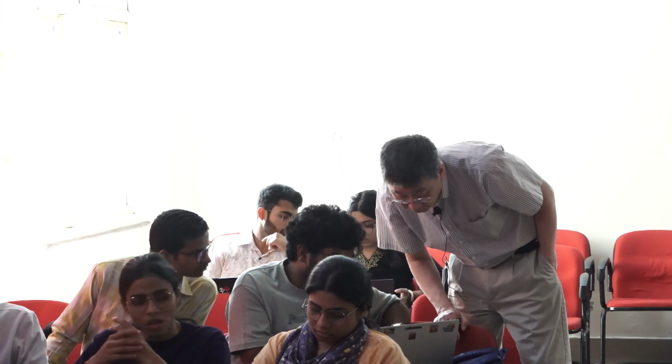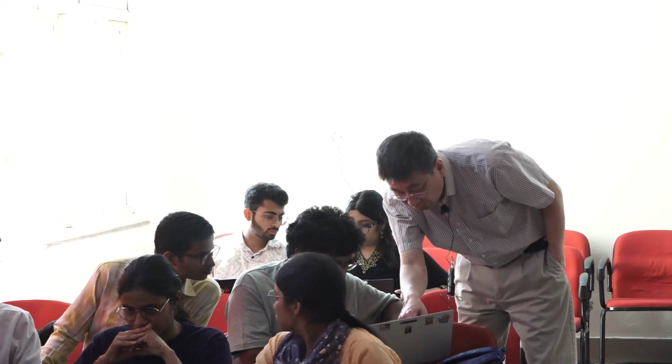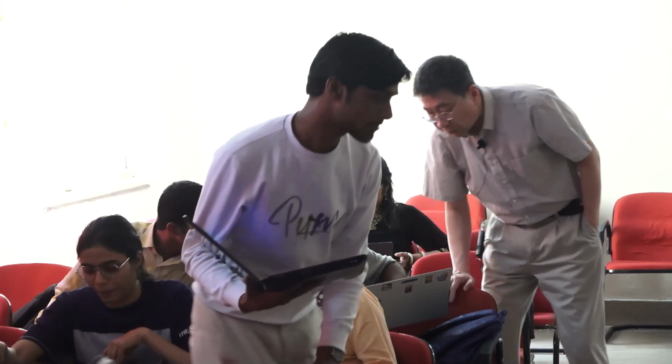Which version of Coot is this? 0.9.8. Okay. Do you still have a water there? No, I removed that. But there's a water right there. See? Yes, that needs to be removed.